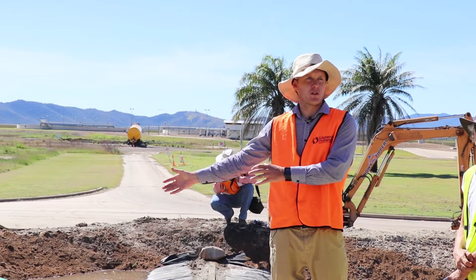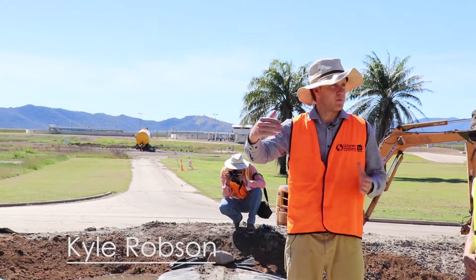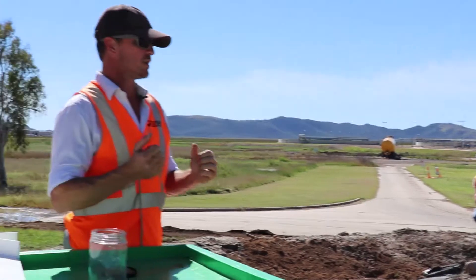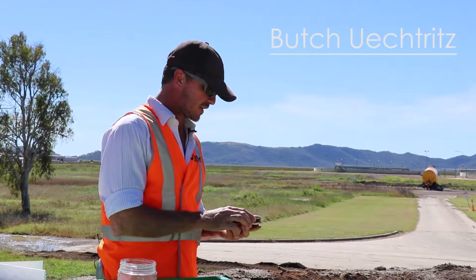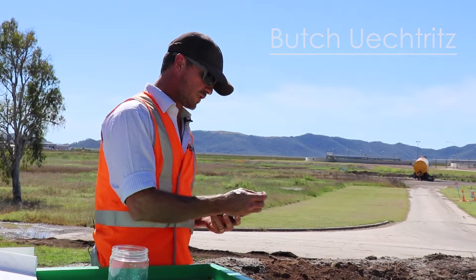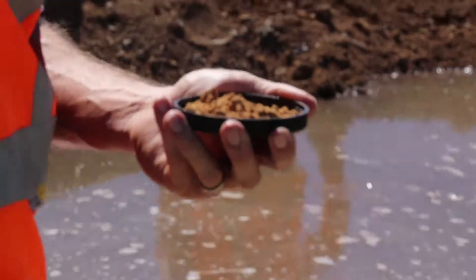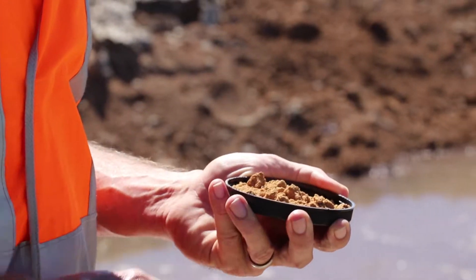If you've got a water sample that's ideal, great. If not, this is how you go about mixing soil with water to come up with that. In the lab, we get a soil sample like this — there are stones and whatnot in there, which isn't going to be representative of what actually enters. What we really want to work out is the fine component.